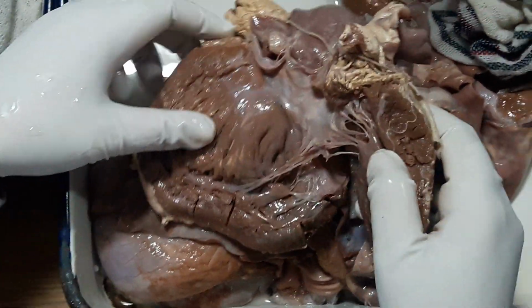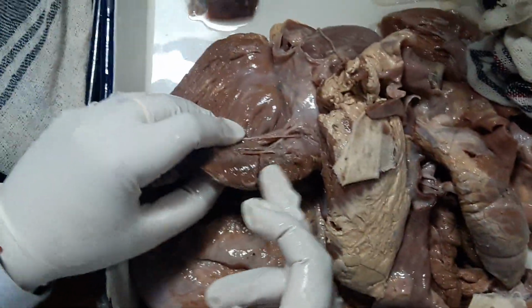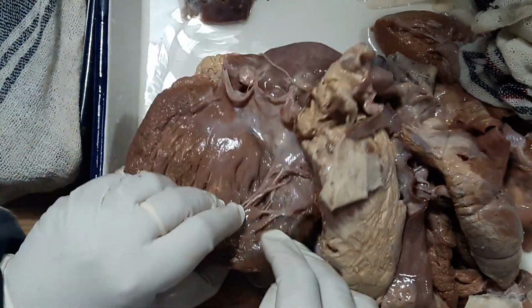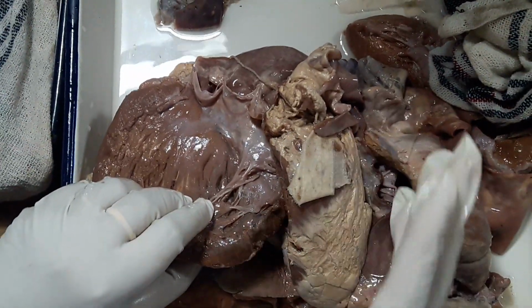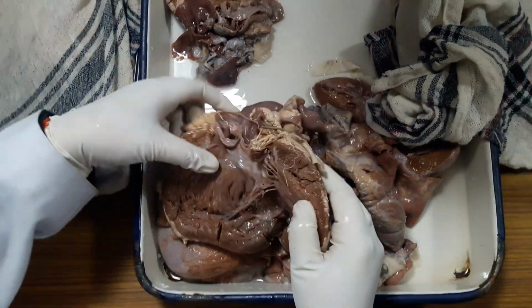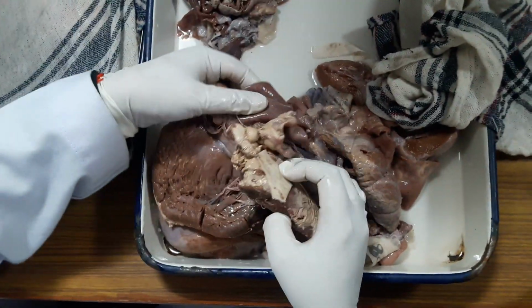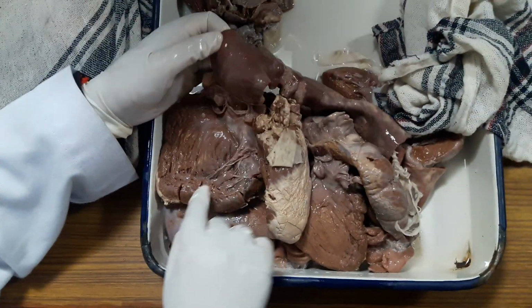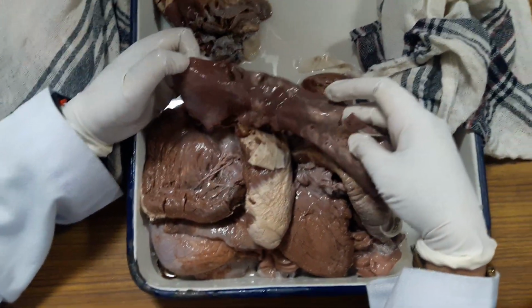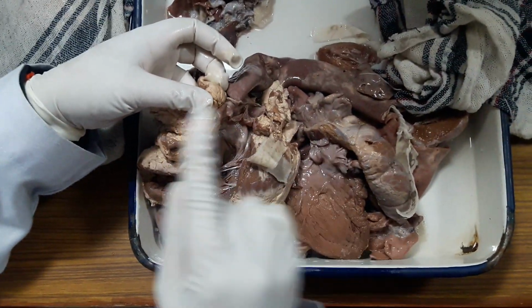Here you can see some blackish discoloration, here also in the wall. Probably this patient had a myocardial infarction, and we have to take a block from that to confirm, because these specimens are pretty old, so there is a difficulty at times to tell about the pathology, but one must look for pathology quite minutely, otherwise you will miss this kind of discoloration. And there is atherosclerosis also, and in such a case it is mandatory to look for the artery also.